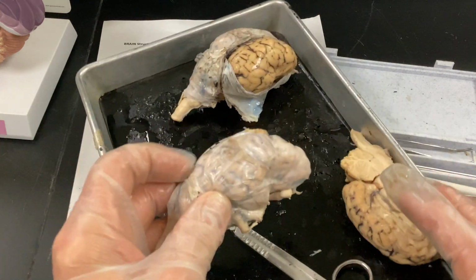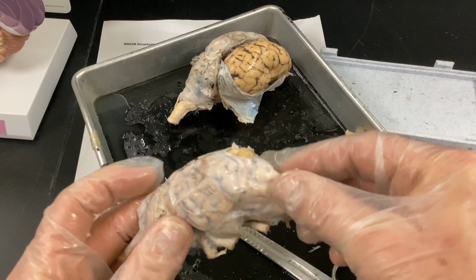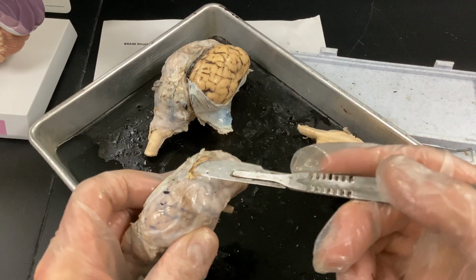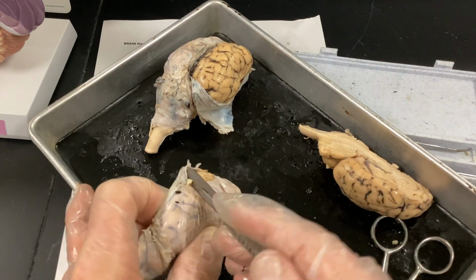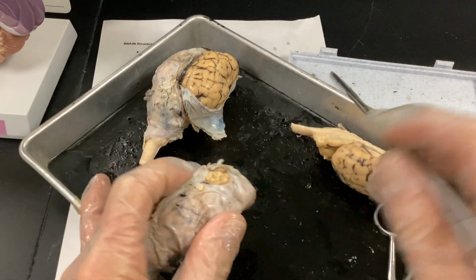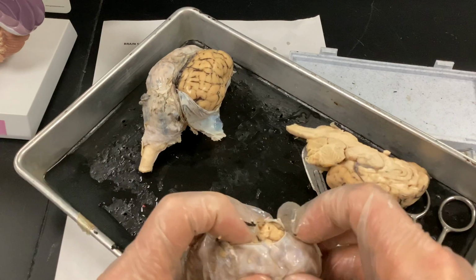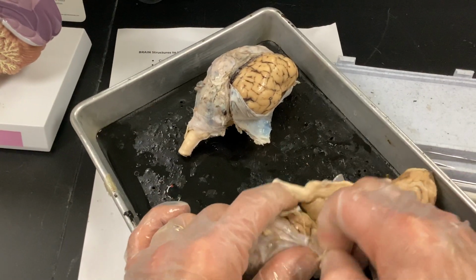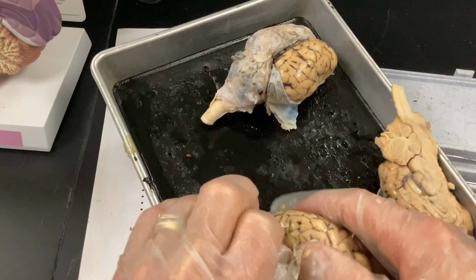All right, so when you get to lab, if they have something up here pinned, that's going to be your frontal lobe. And behind that's going to be your parietal, and the posterior is going to be occipital. That's going to be for your vision. Then I want to really point out the central sulcus here, and that really divides your sensory and your motor cortex.